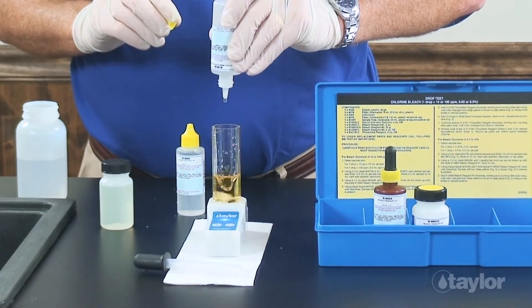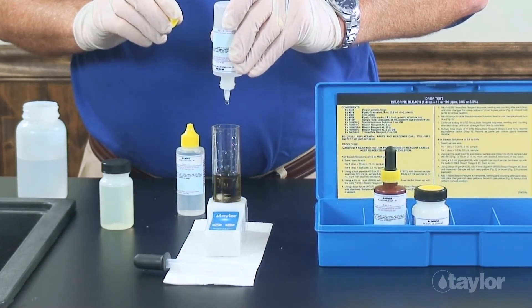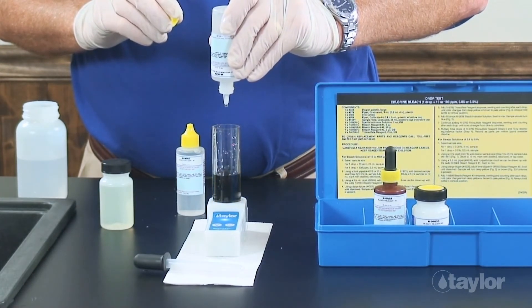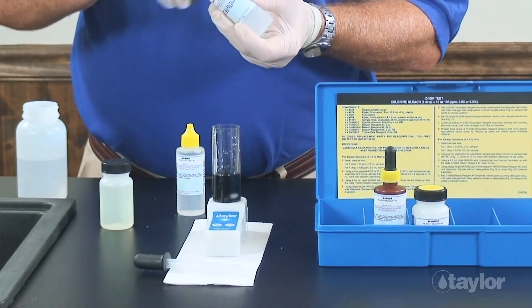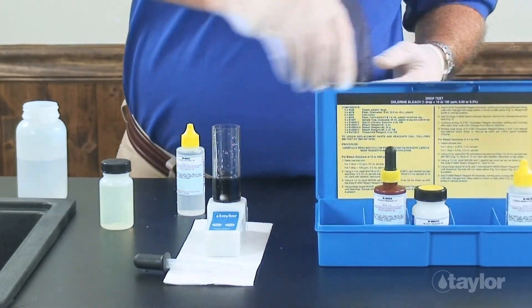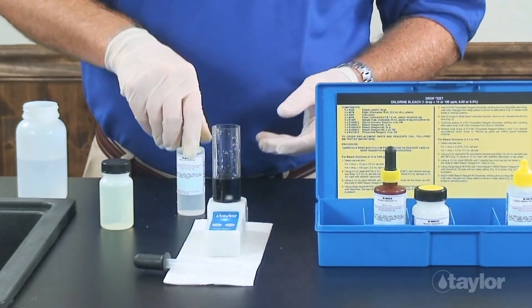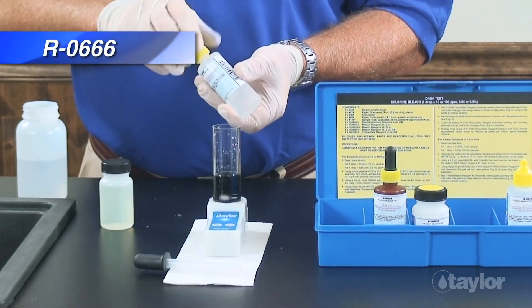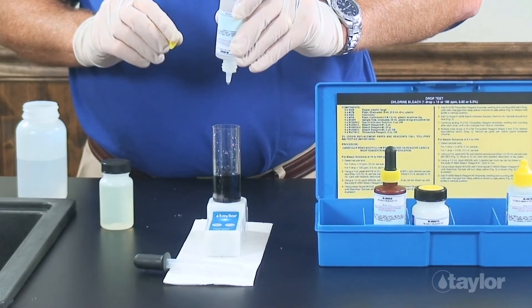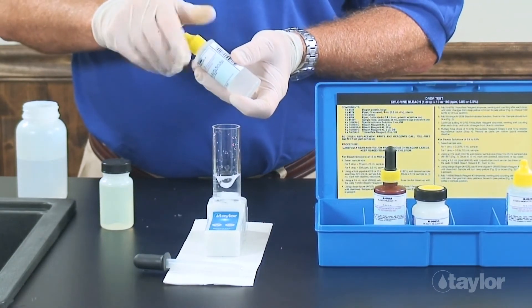Swirl to mix — the sample should turn blue. Continue adding bleach reagent number three drop-wise, swirling and counting after each drop, until the color changes from blue to colorless.